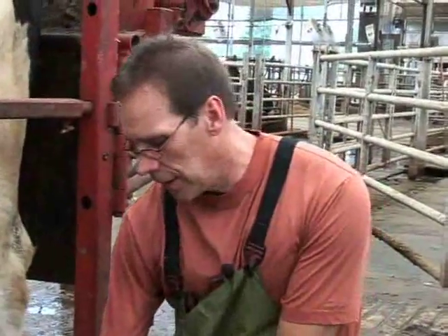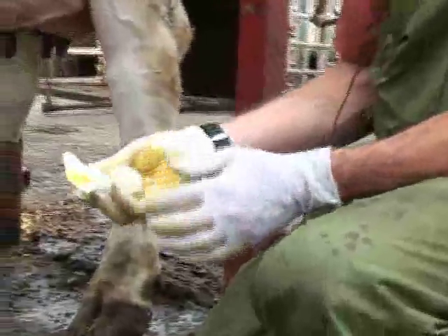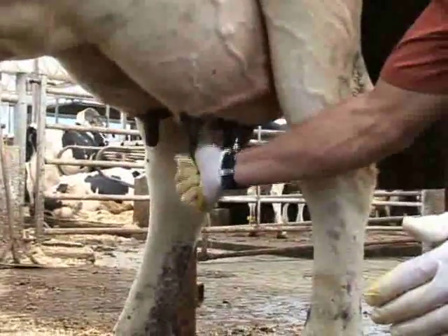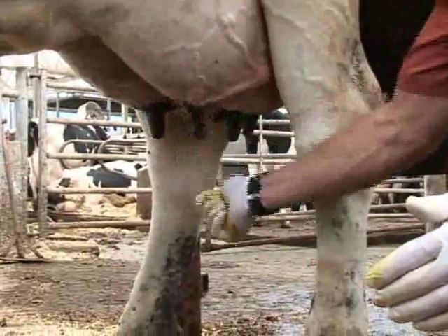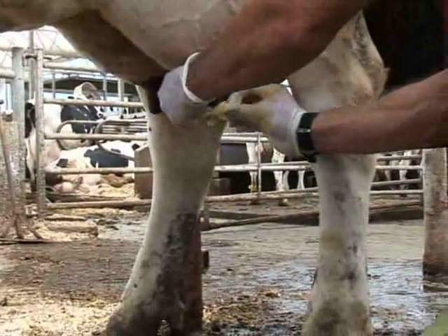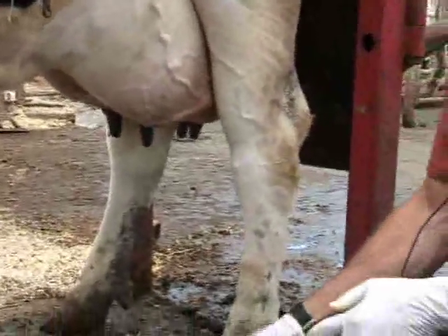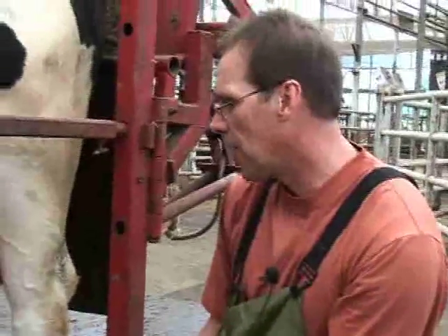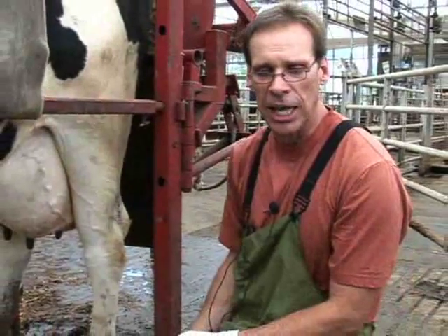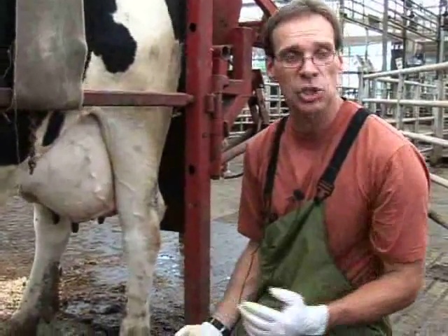After 30 to 40 seconds, we will clean away all of the iodine by using alcohol wipes. We'll take all of the iodine off the top of the cow's teat, aggressively cleaning the entire teat surface, and then paying attention by turning the swab over to the clean side to clean the very tip of the teat aggressively. Once the teat is cleaned with both iodine followed by alcohol, we must allow the alcohol to dry. We cannot allow a drop of alcohol to enter our tube, because it may actually kill the bacteria we need to identify as causing this infection.